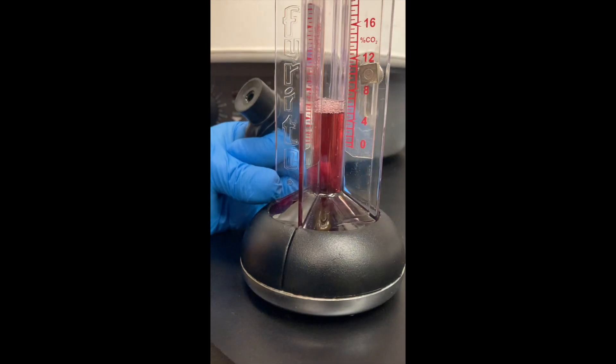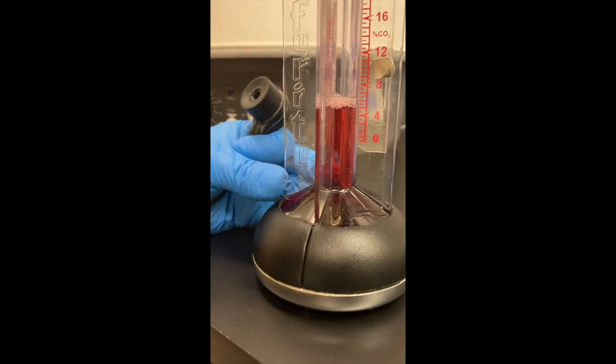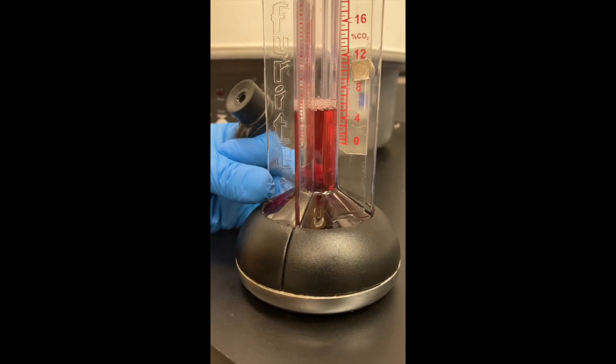So this should be right at 5, around 5. So that's how much we have in our incubator.